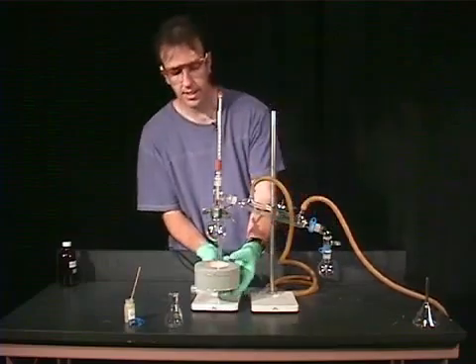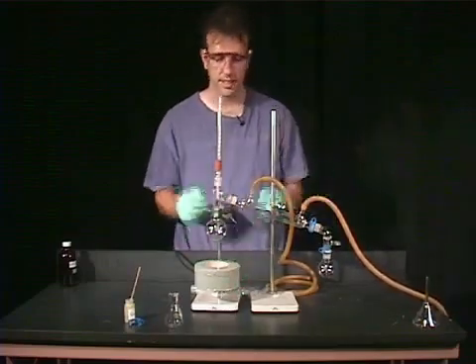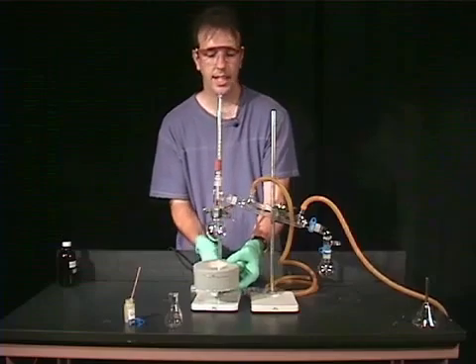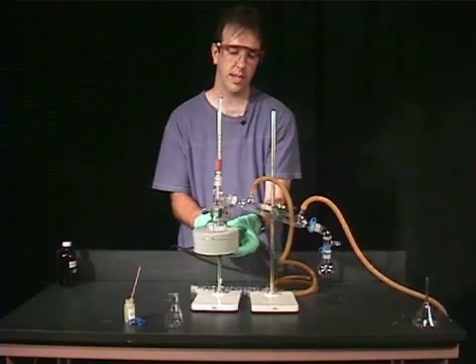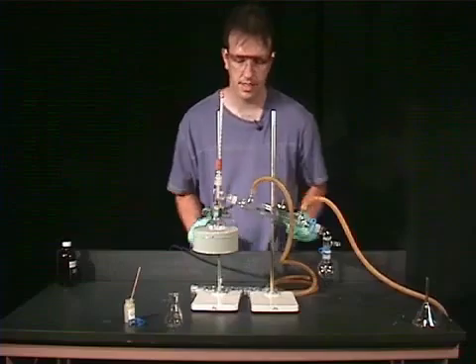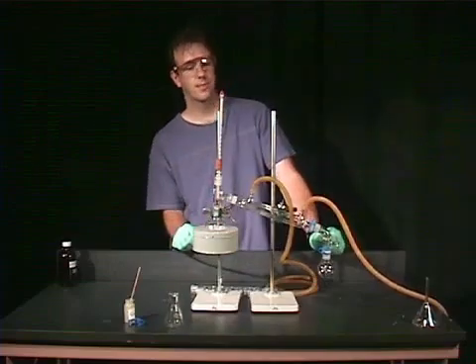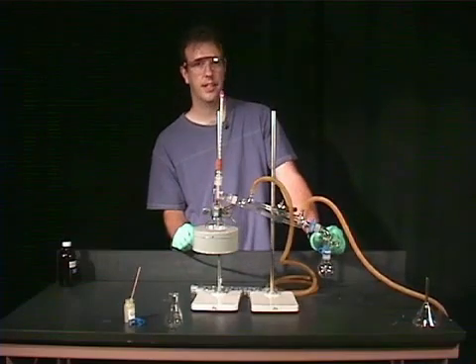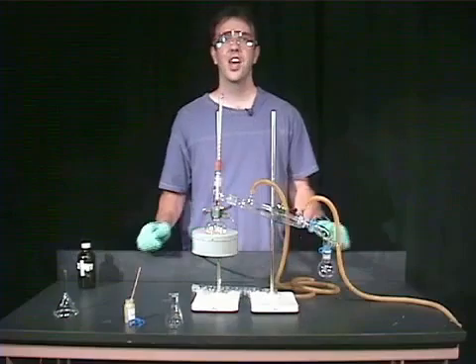So this is what a simple distillation setup looks like. Finally, if everything is set up correctly and everything's nice and secure, you can raise what is referred to as a heating mantle up and get a nice snug fit with our setup.